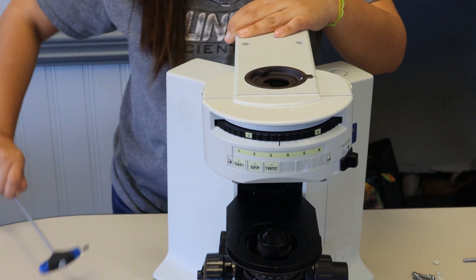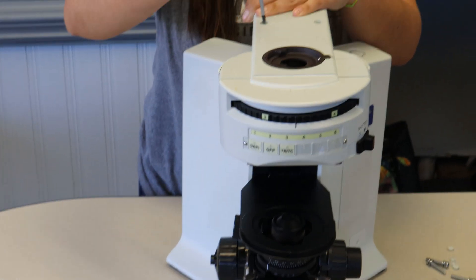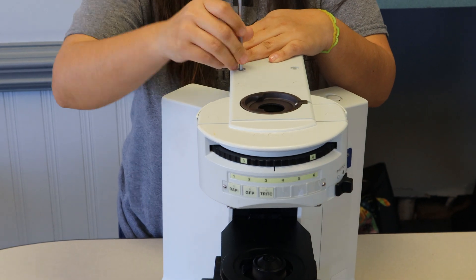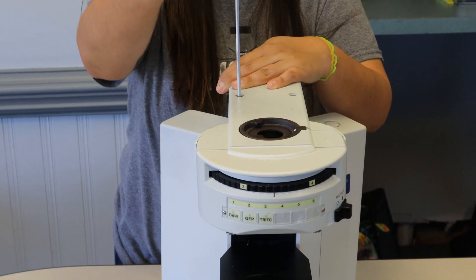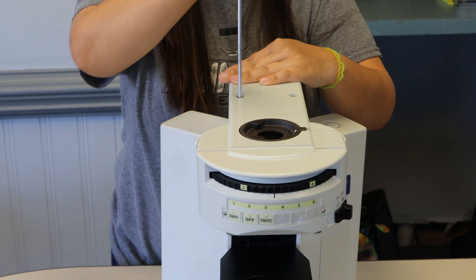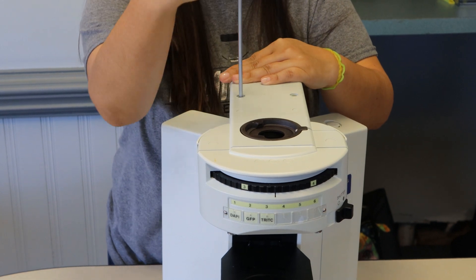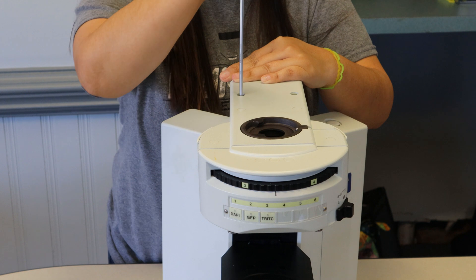So once it's in position, you take your big 4mm wrench and slide it down into those bolt holes and just start threading them in place. We're going to let Maria go ahead and get those all tight. You just want to snug them up. Don't crank them down too tight as you could risk stripping the bolt out.